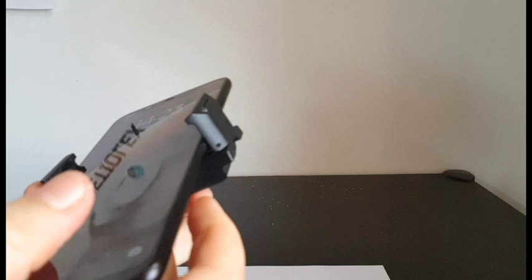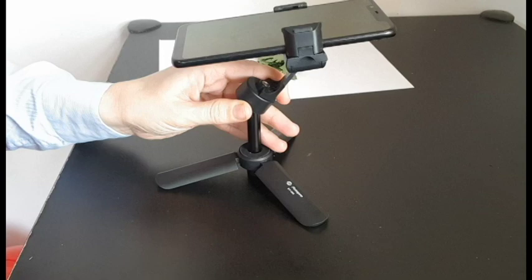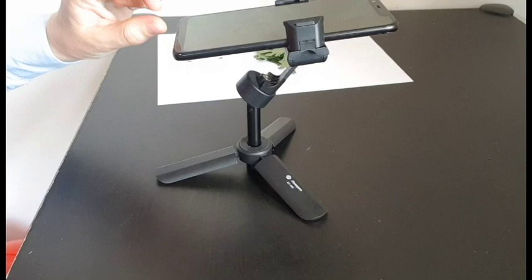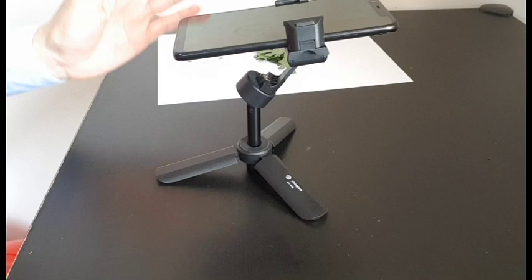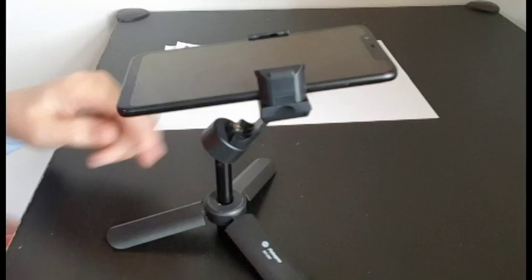First of all, I will place my mobile phone and fix it in the holder and place it at a stable height, so all my measurements will be made from the same height. You also need to be sure that the angle between the stand and the table is 90 degrees and that the phone is parallel with the table. In our case it's a little bit off, but for our purposes it will be fine.